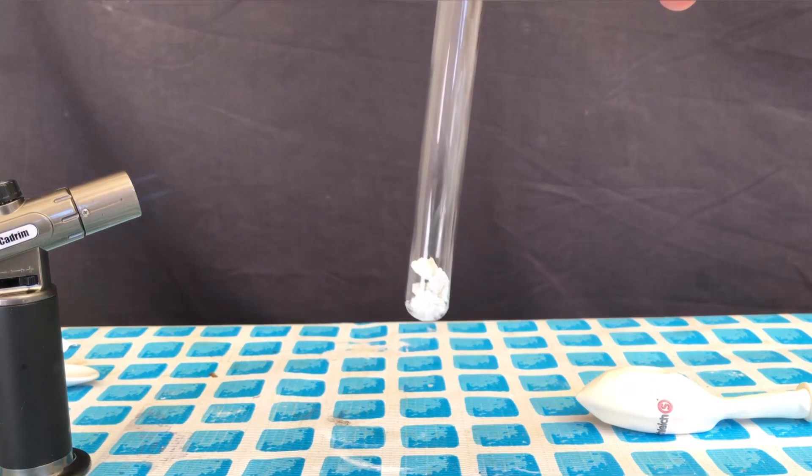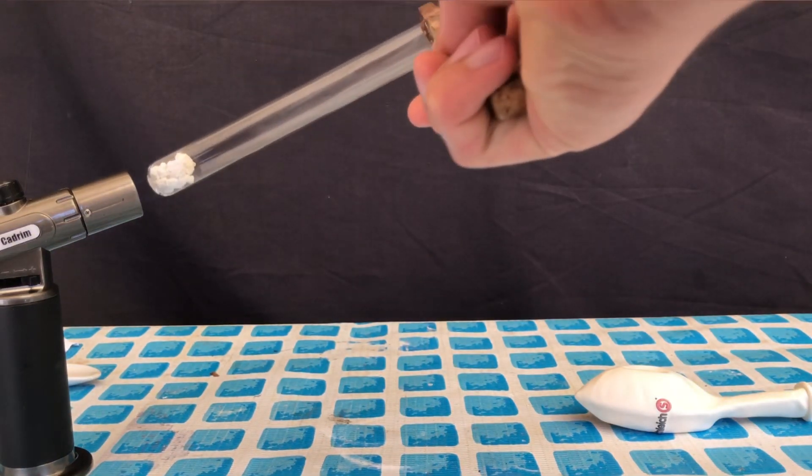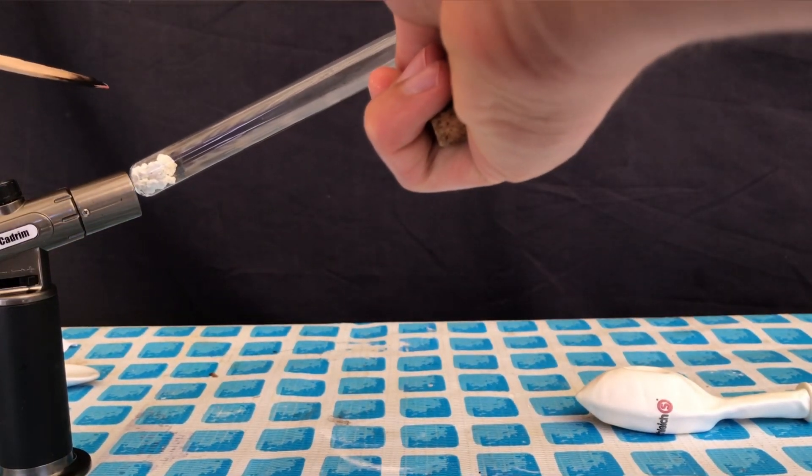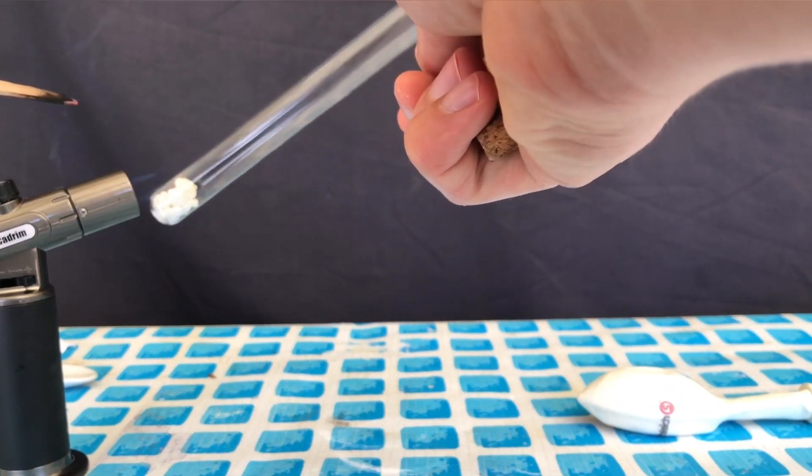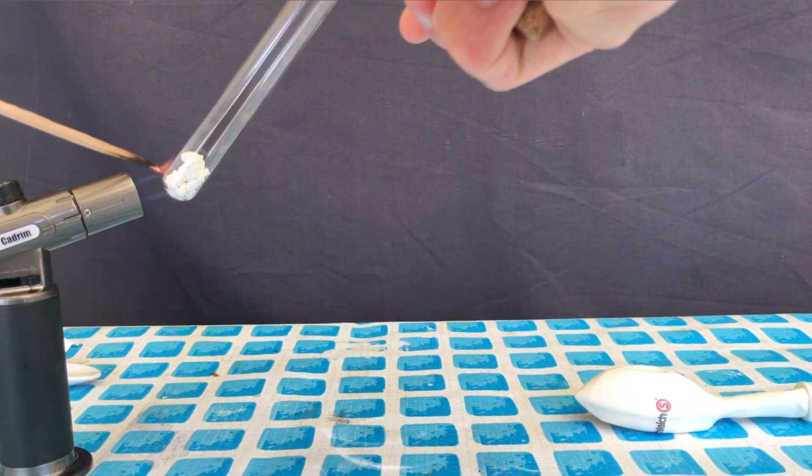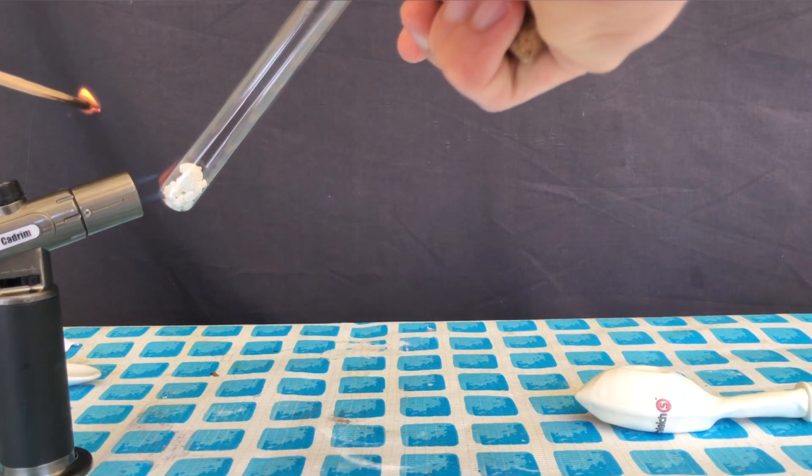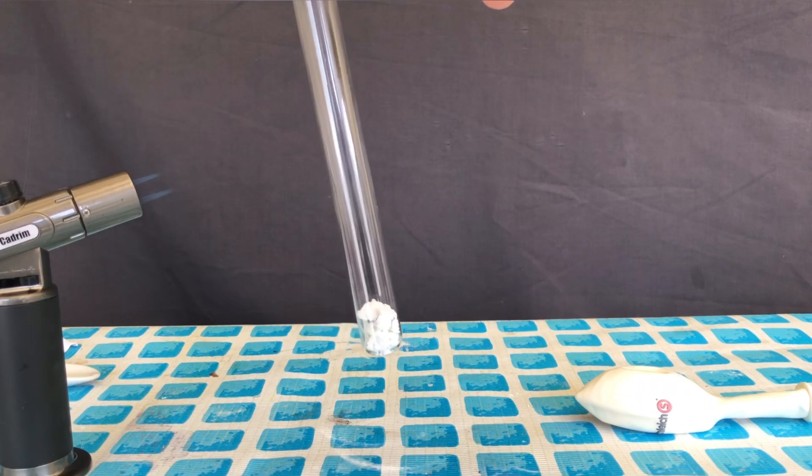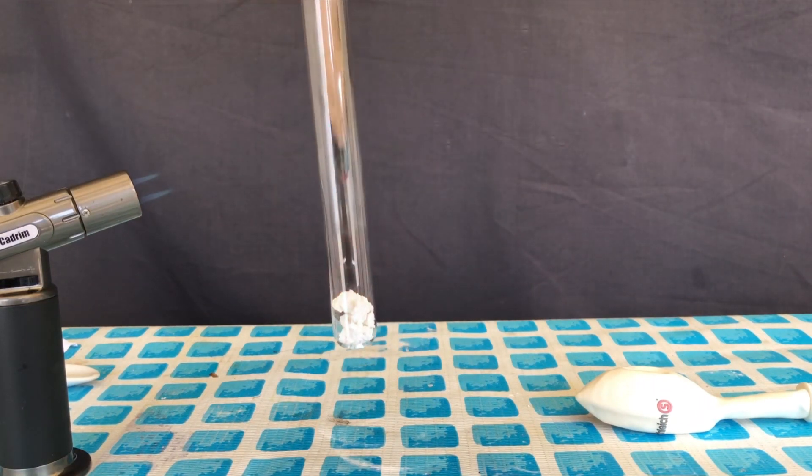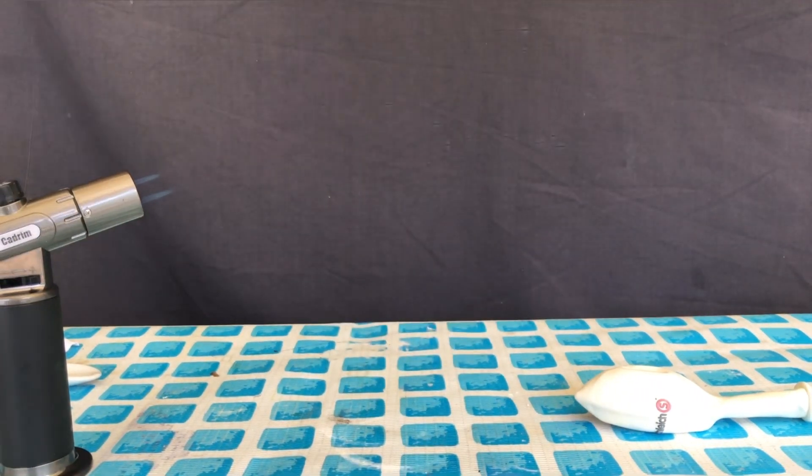After only a little bit of time, the balloon started to inflate. The test for the presence of oxygen, a piece of wood, was set on fire and you can see that it's only glowing now. The calcium peroxide was heated a little more and if you hold the splinter into the tube, you will be able to see that oxygen has been generated. The flame became brighter, indicating that the experiment worked out.